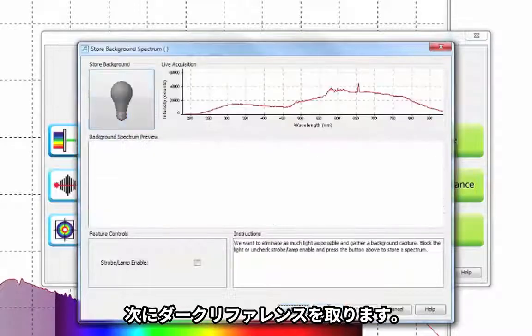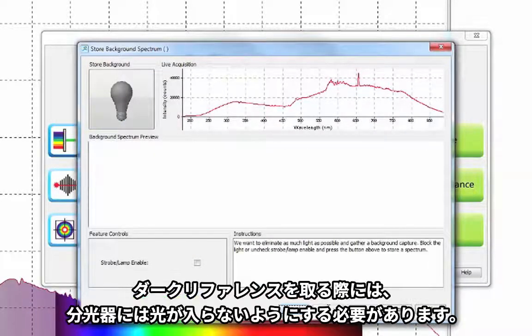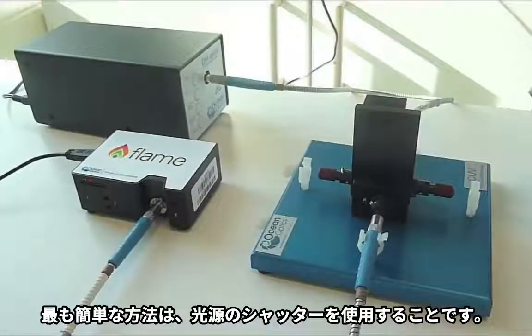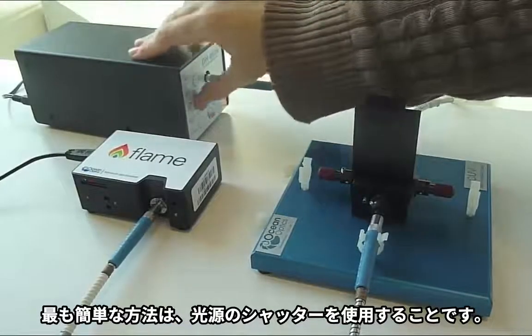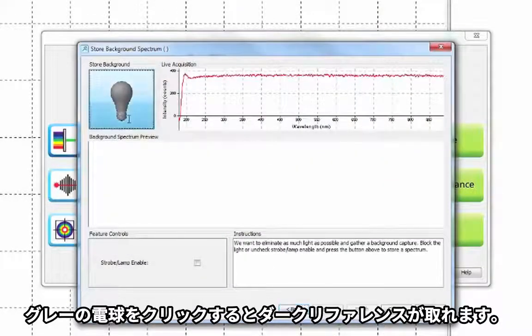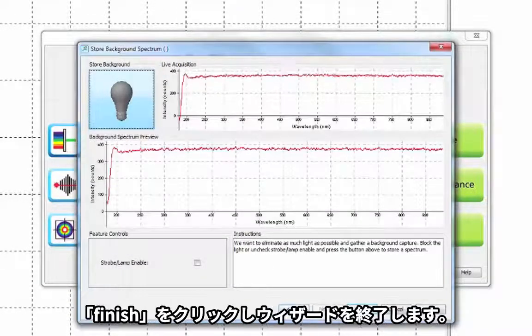Next, you'll be asked to take a dark. This requires you to stop any light from getting to the spectrometer. The easiest way to do this is by using the shutter on your light source. Click the grey bulb in order to take your dark. Now press Finish to close the wizard.